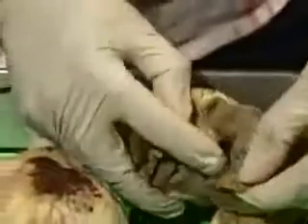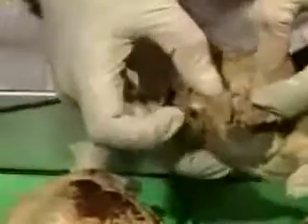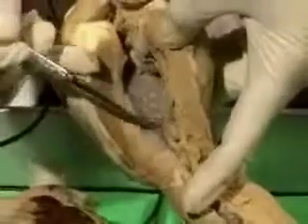So here it's rough where you have the musculi pectinati, and the rest of it is smooth, and here this is the mitral opening going from the left atrium into the left ventricle. You can see it entering here into the left ventricle. So just as the muscle in the atria were called musculi pectinati, in the ventricles, remember, they were called trabeculae carneae because they are so big.